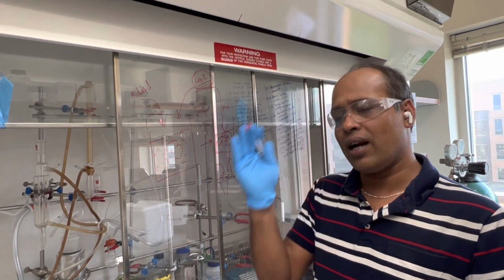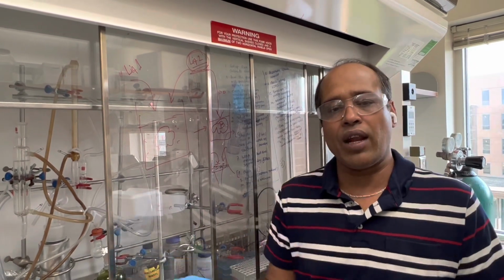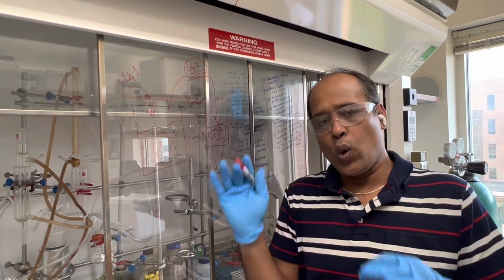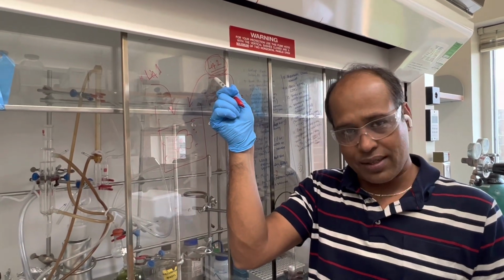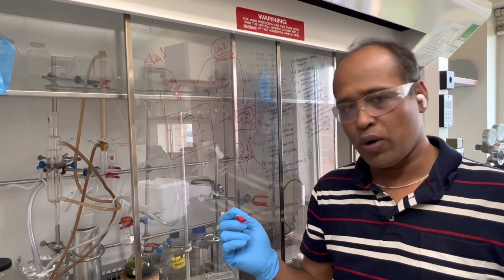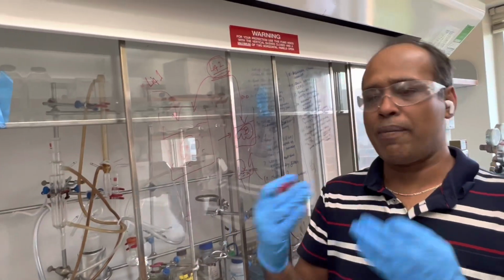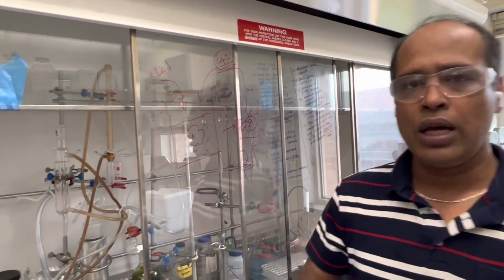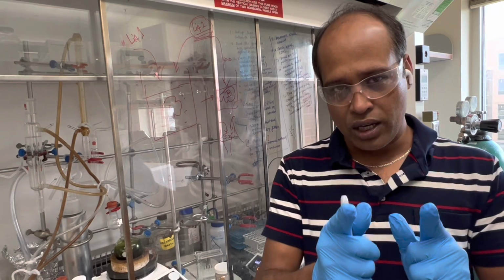That means the other liquid present in the reaction always helps keep things in liquid form. So your product was in liquid form with the other liquid. Any excess will normally go into the solvent, and that's why you're getting your product as a gummy liquid. In that case, you have to try many other things. First of all, let me tell you a ninja technique.